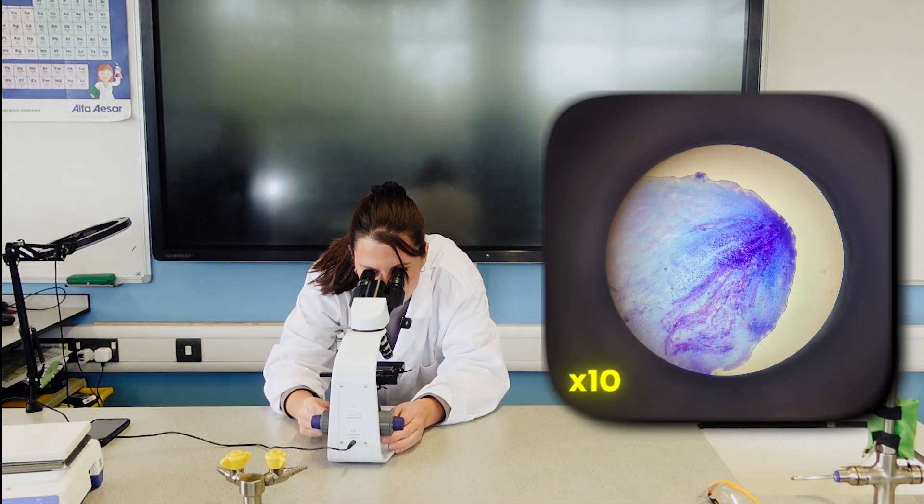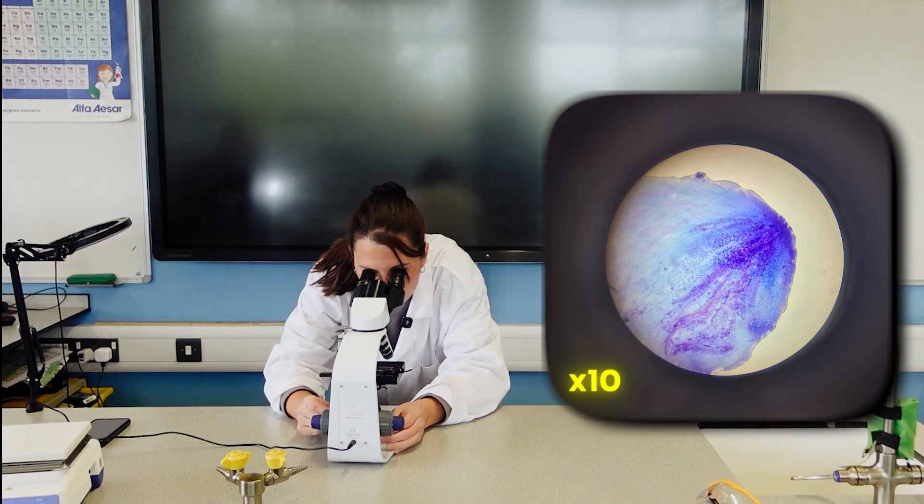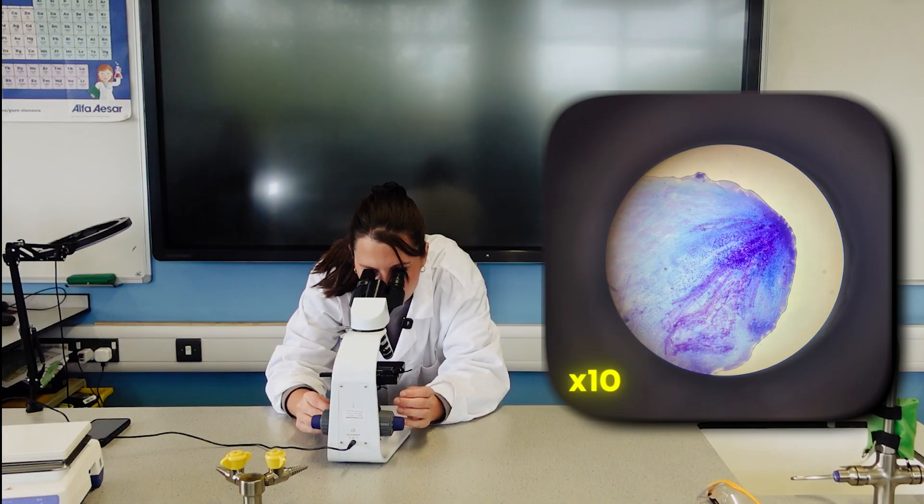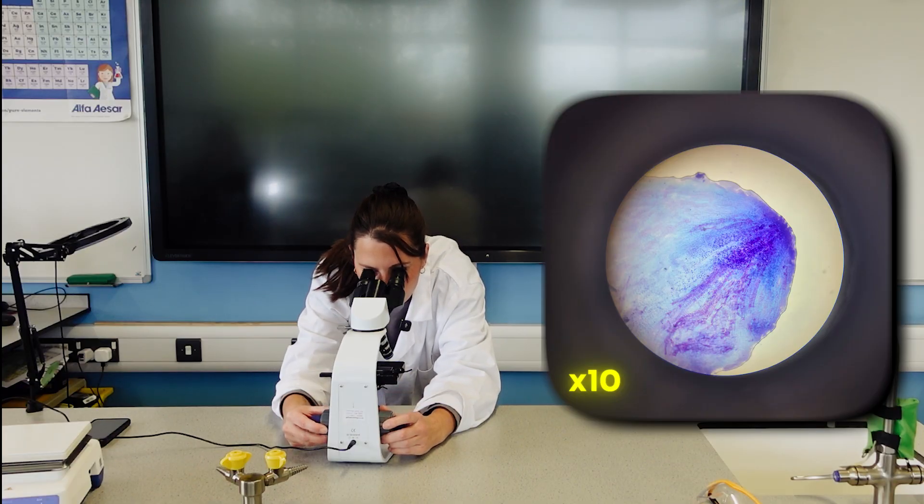So I can still see, but I'm just going to slightly change the position because I can see a section where I think hopefully we'll get some good cells to see.